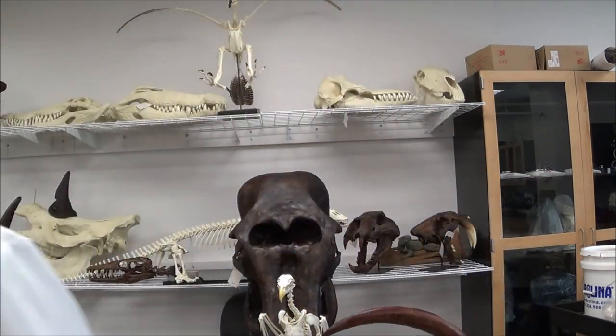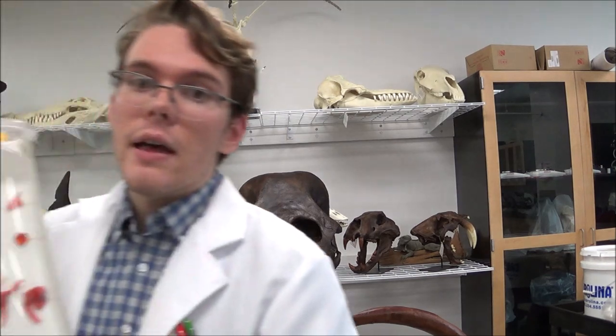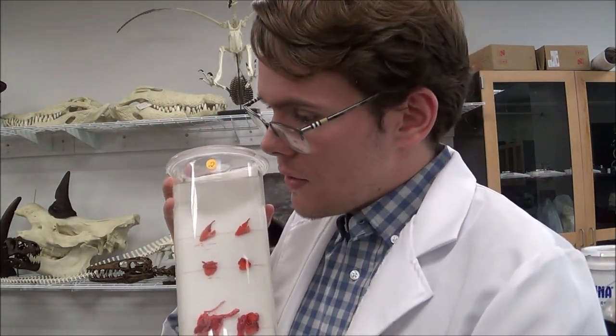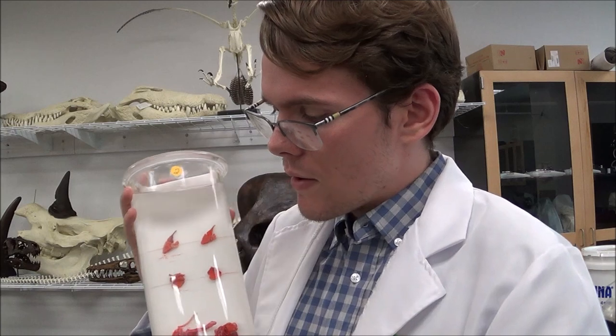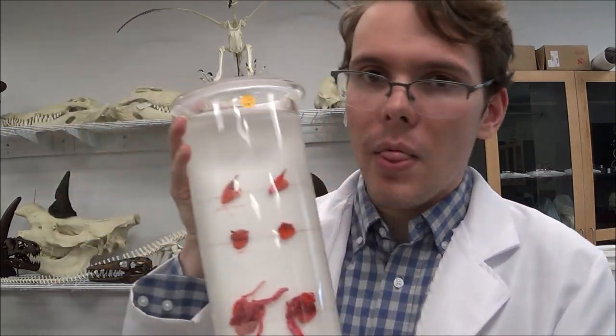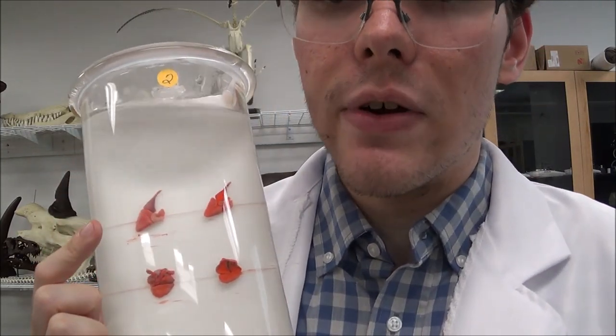We've compared the skulls and the brains. I want to compare one more thing as well. In Procedure 2, we're going to take a look at the heart. Here we have a similar setup where we look at the hearts of each of these creatures going through evolutionary time.